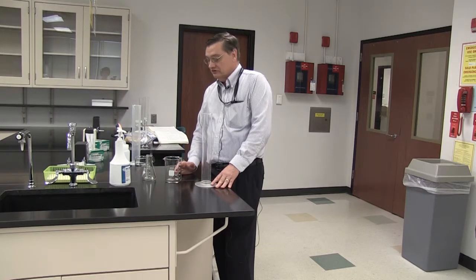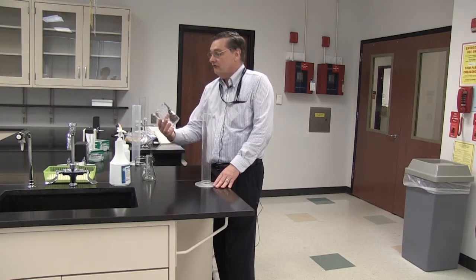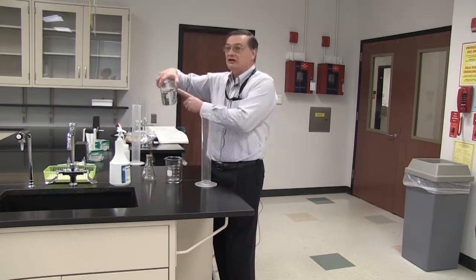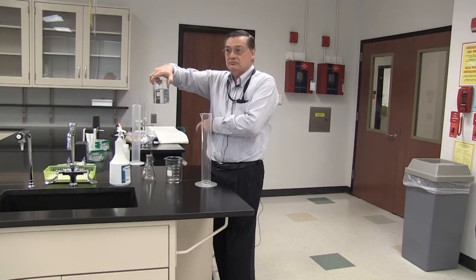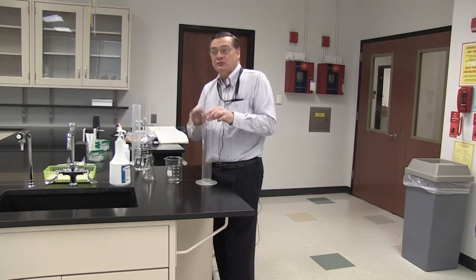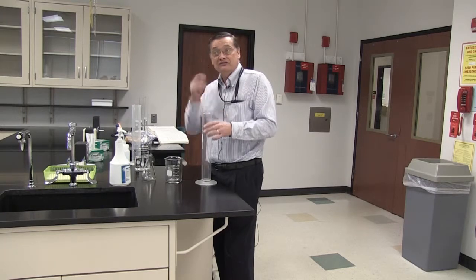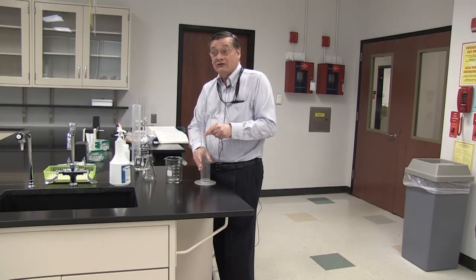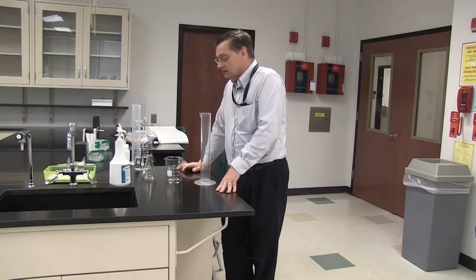Now, these are all perfectly useful devices for holding liquid, but they're not equivalent in terms of measuring liquids. In fact, often the manufacturers will put, this one doesn't have it, but this one does, that these are approximate measurements. Right? A graduated cylinder is a more accurate measuring device.